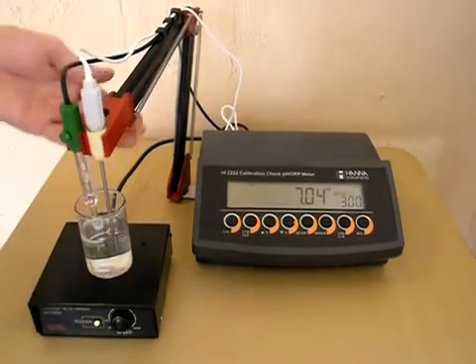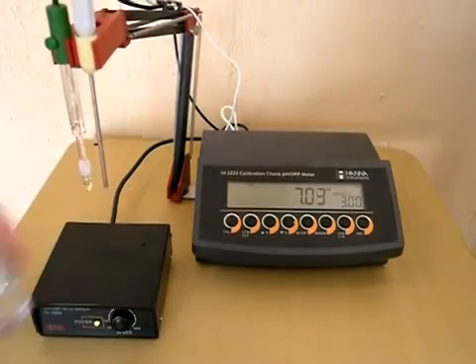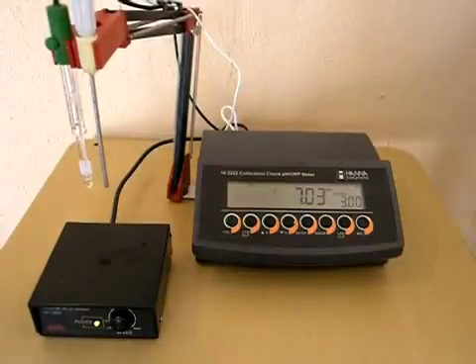Turn off your stirrer. Give your probe a quick rinse with some deionized water.